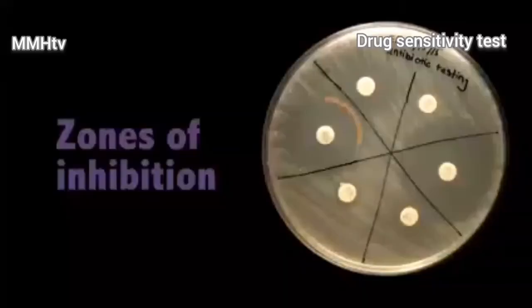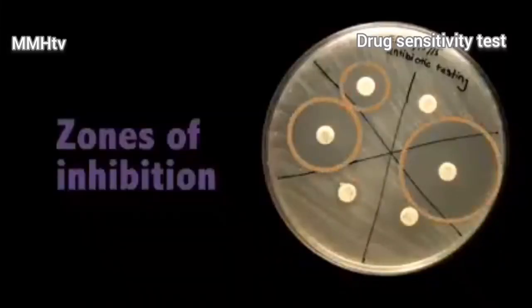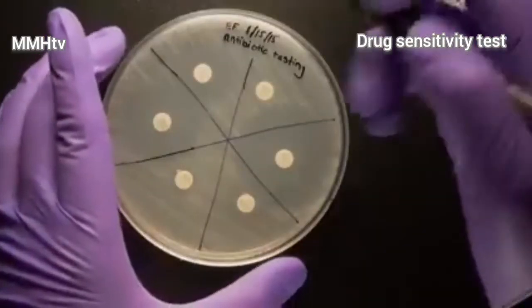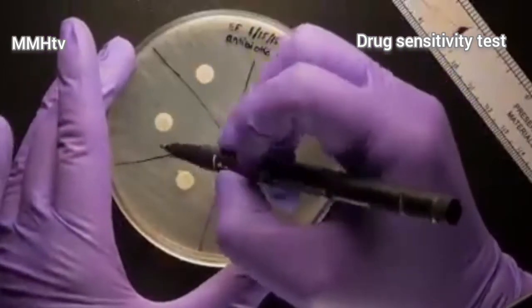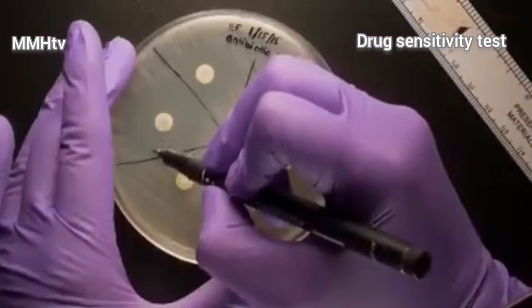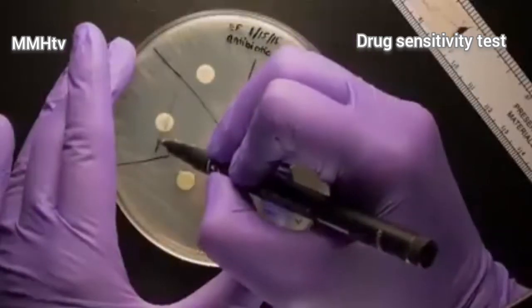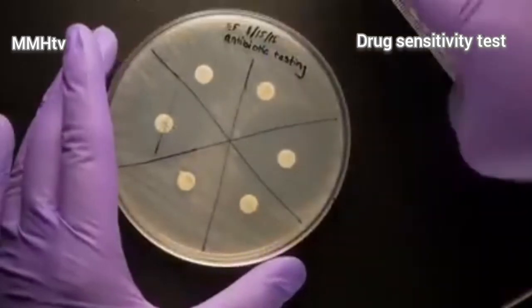After the bacteria have grown in those 48 hours, you will see a clearing around the antibiotic discs. These are called zones of inhibition. This shows how good the plant extract is in killing particular bacteria, and therefore its ability to cure a particular disease. You can measure the strength of the drug by measuring the diameter across the zone of inhibition, and measure in millimeters.